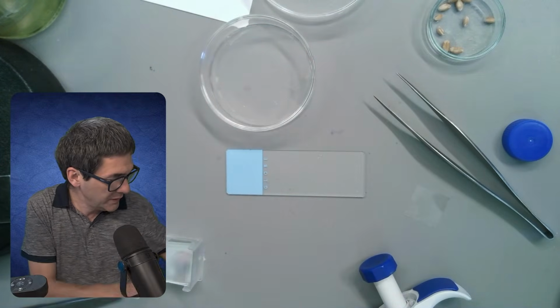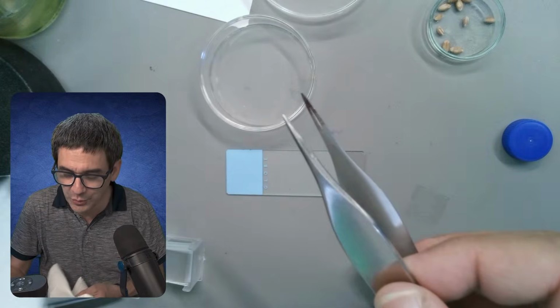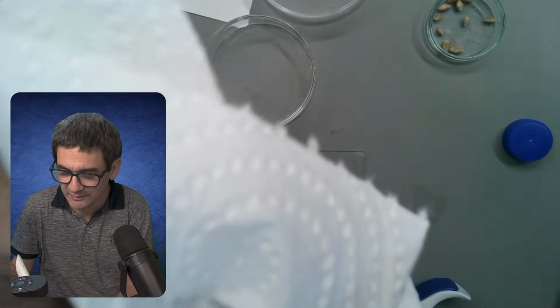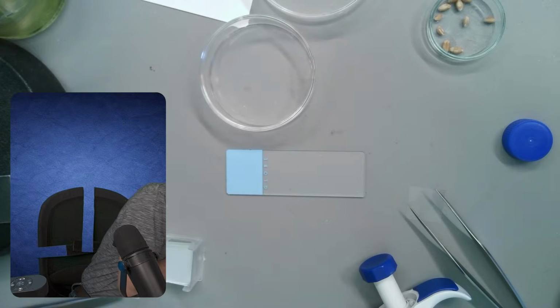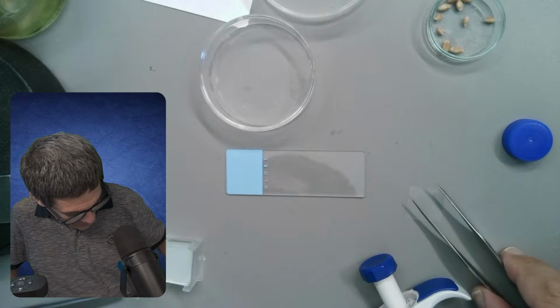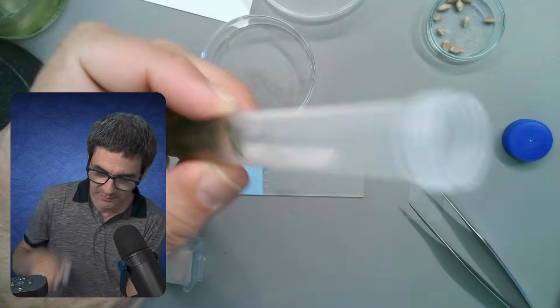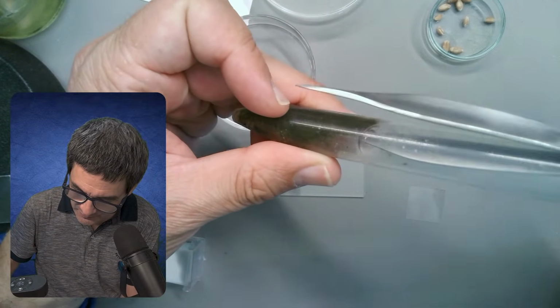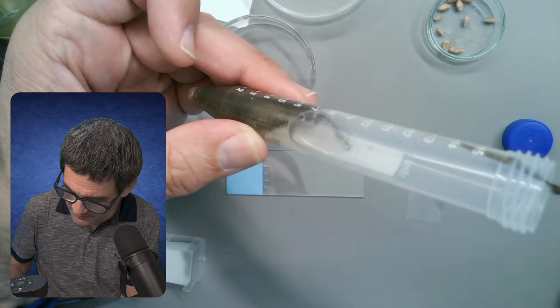So let me quickly, I mean, it's of course also a question: should I use those tweezers to go into the other water sample? I would actually be cross-contaminating it. On the other hand, it'll be fine. So I somehow need to grab some of this stuff here. And let's try this and look at this.